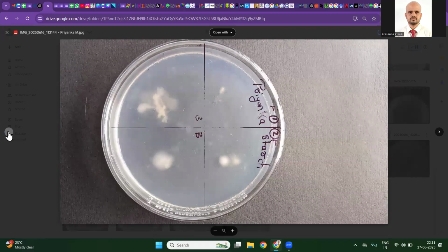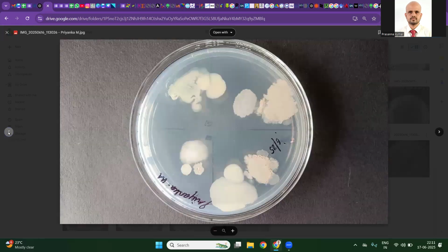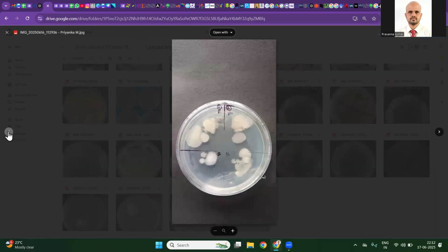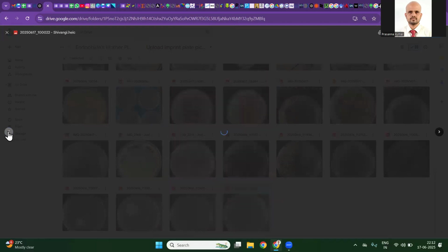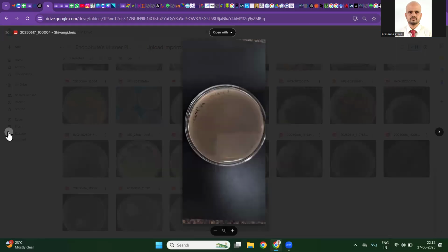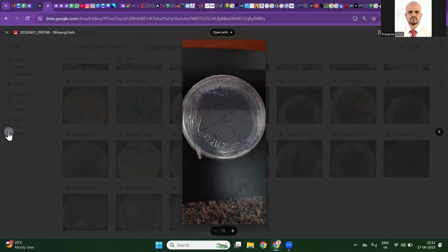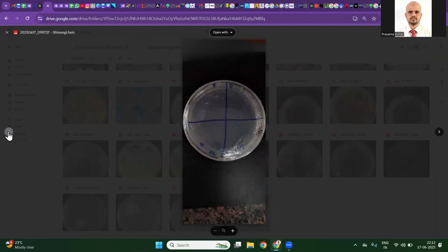When you see a growth in the imprint and also in the laminar control, just don't look into the explant plate or inoculated plate. Anyway, we cannot figure out anything. But today we had one more interesting observation. Oh, no growth in the imprint. Very good. Now we can look into the explant.